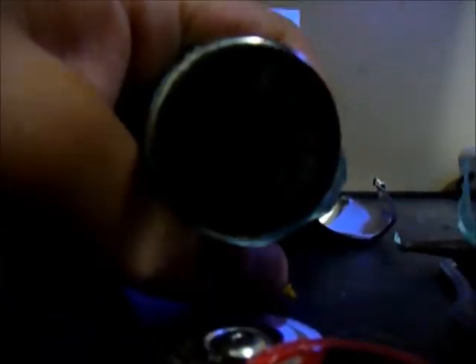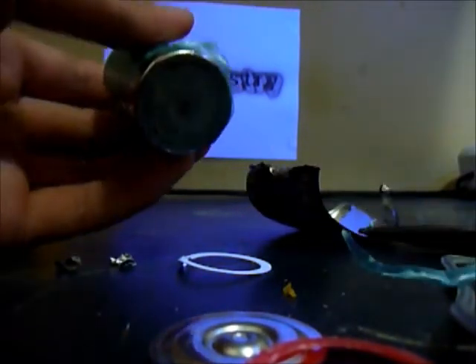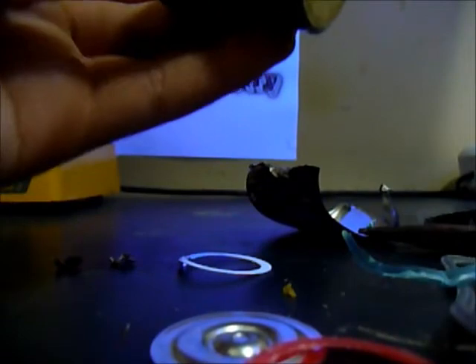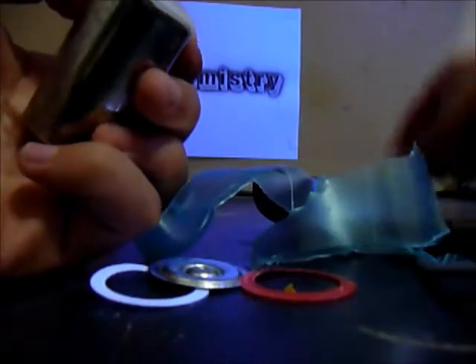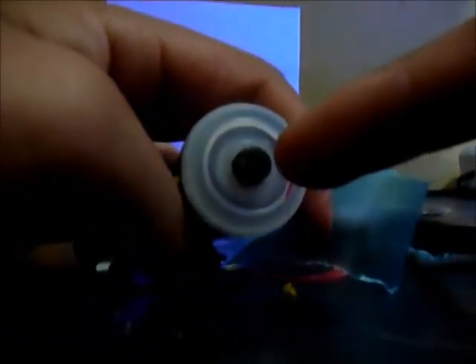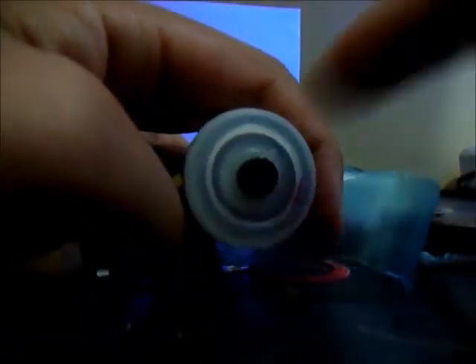And all this right here is pure zinc metal. Not pure, but usable zinc metal, like to make zinc sulfate from one of my previous videos. Okay, that's about it, and you see that right there, that's the carbon electrode.